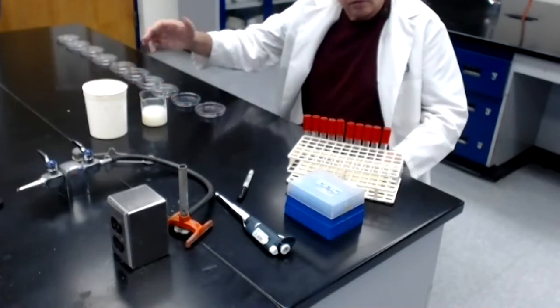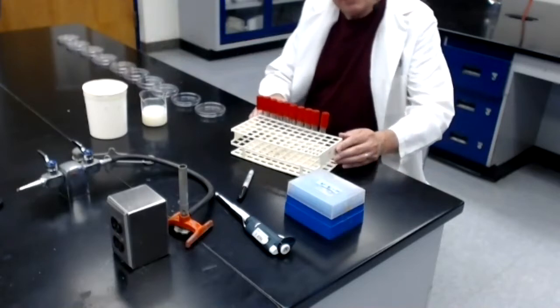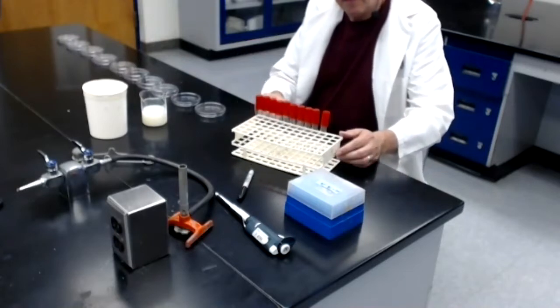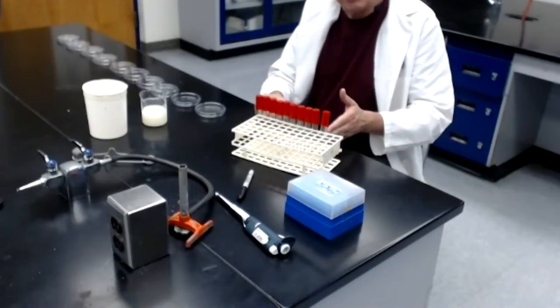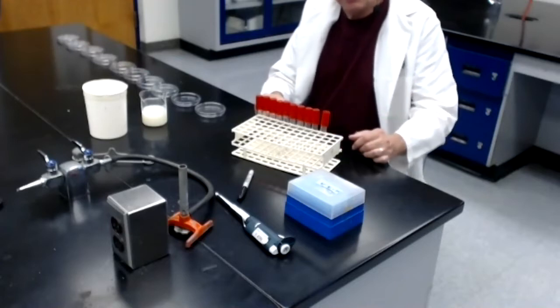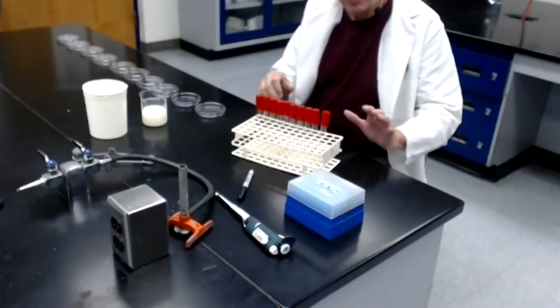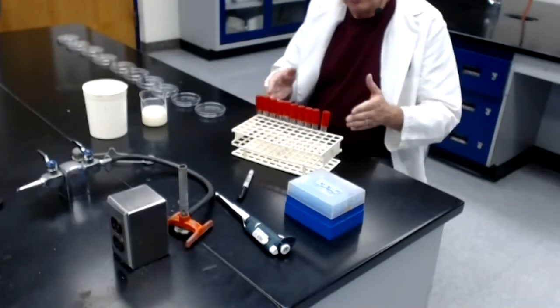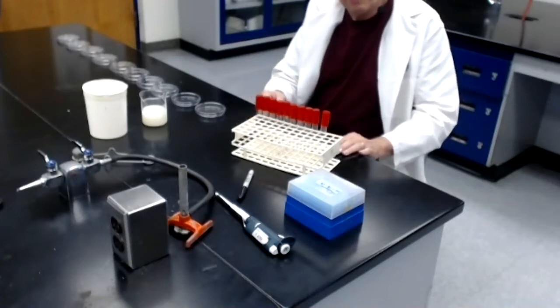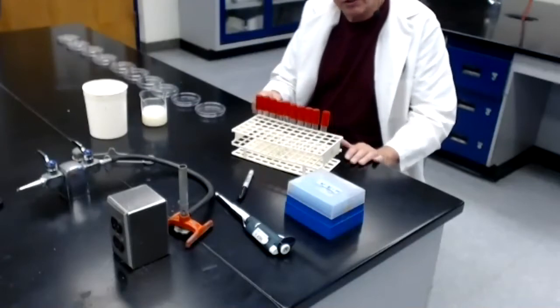So overall, the idea is this. We take these 10 tubes of sterile water. There are 9 mils of sterile water in each of these dilution tubes. The volume is important because what we're going to do is use these tubes to carry out a series of 1/10 dilutions.